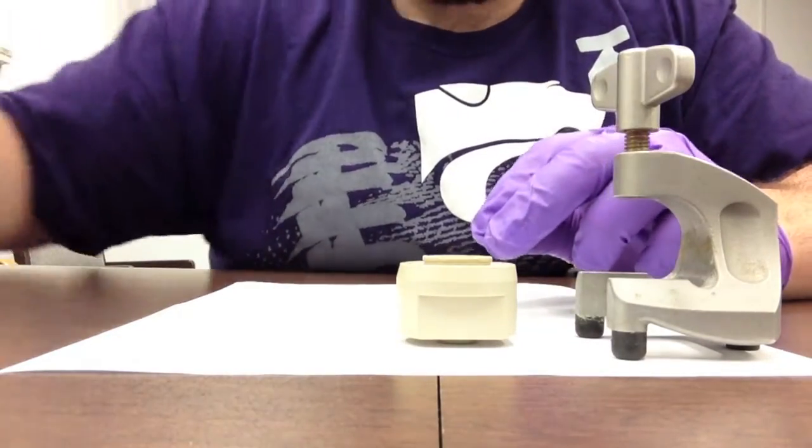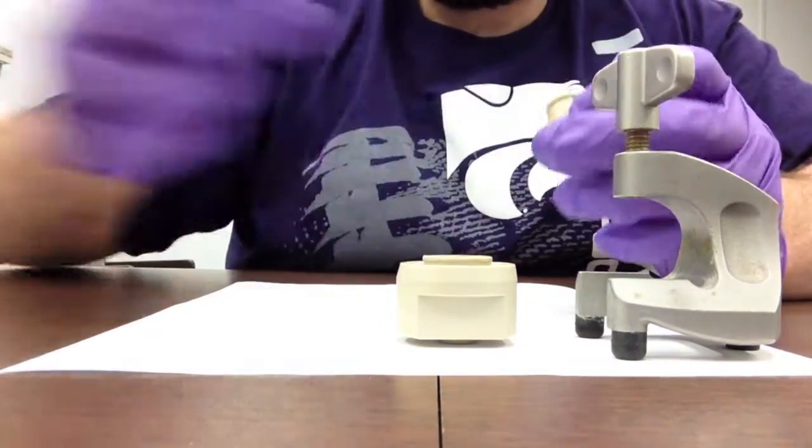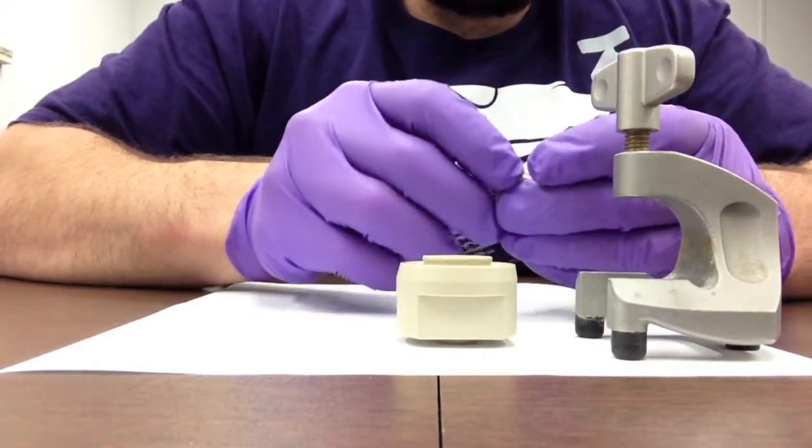It also is a piston type, so at the top is the piston head which has its own o-ring and creates the top seal.